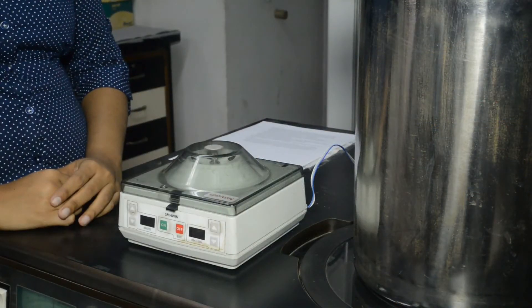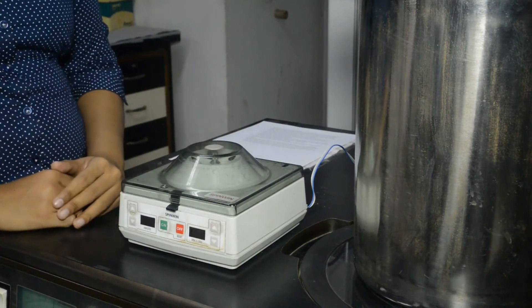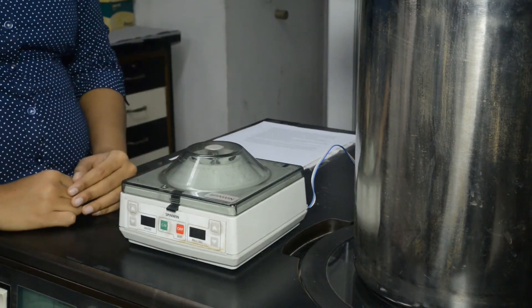It is possible to use a lyophilizer as a speed vac, provided we have a mini centrifuge which can be fit inside the vacuum chamber of a lyophilizer. This is a centrifuge salvaged from discarded items and its 12V motor was working.